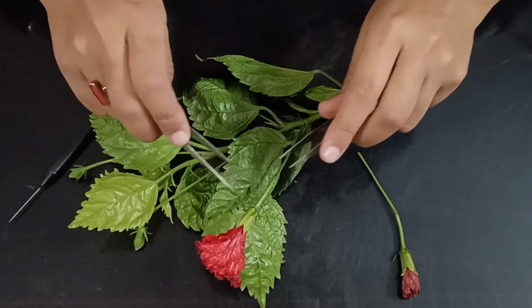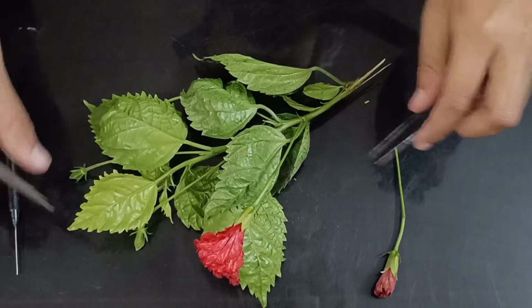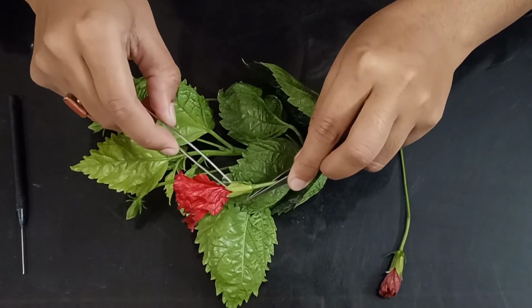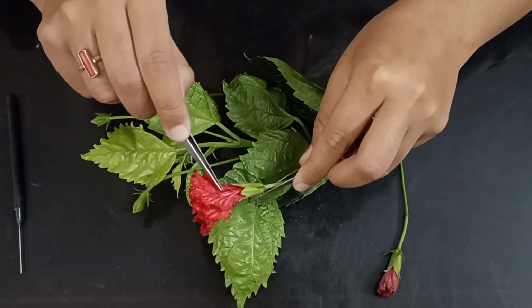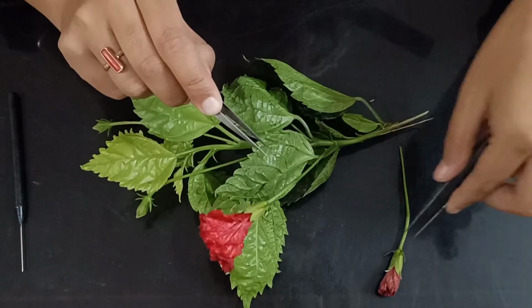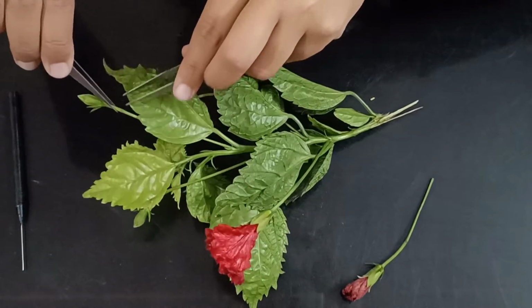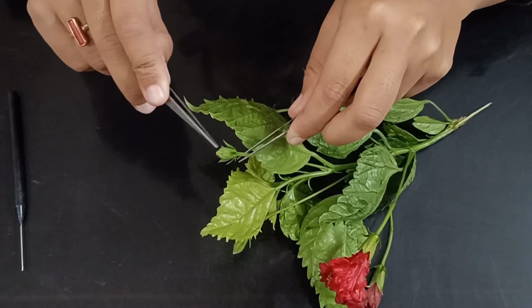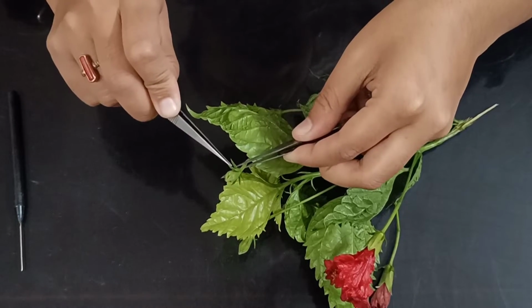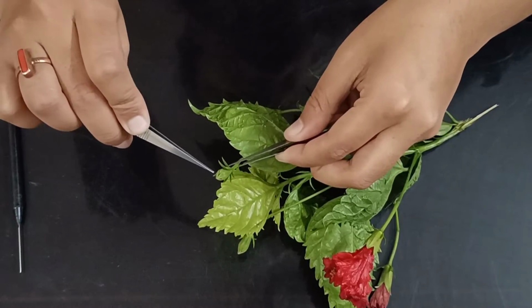Okay, so now coming on to the flower. Firstly we will dissect the flower, and then we will go to this stage, and then onto the bud. Starting with the flower, you see these are the sepals, right? And these are the petals. Sepals are these green structures you see. You can see in this stage also, these are the sepals. And in the bud stage, the sepals are covering the petals inside. You cannot see petals here. You can just see the sepals covering every other part of the flower inside, right?